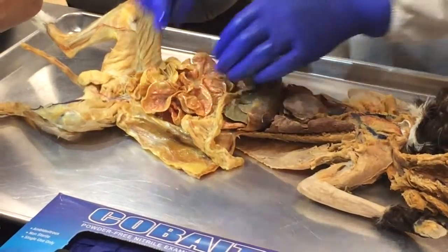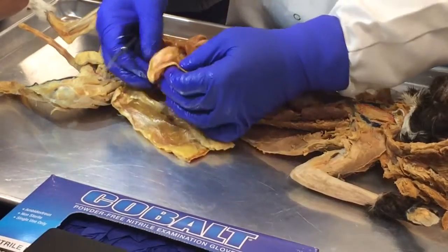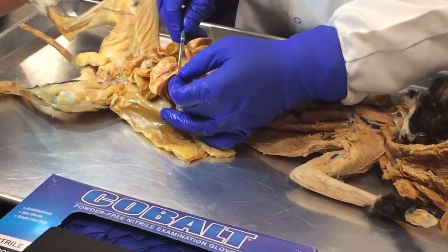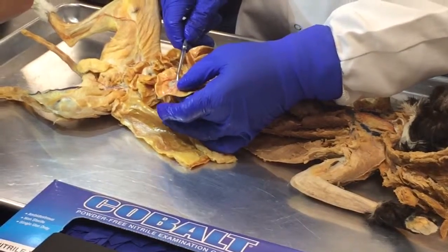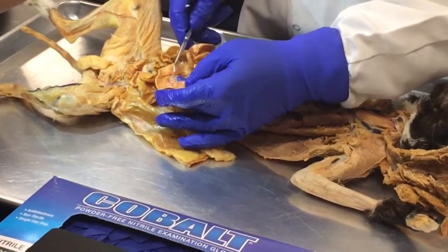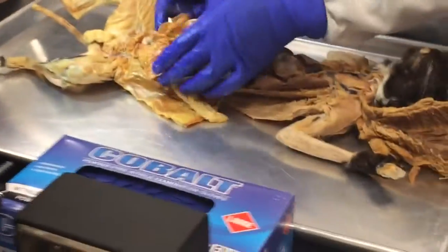You see what I'm saying? And then of course, you see how they are all arranged from the mesentery. So this is the mesentery. If I put a sticker like in there, don't say red blood vessel because I might just use this to tag it to hold it. You say mesentery, okay? Don't say red blood vessel. Okay, so that's that.